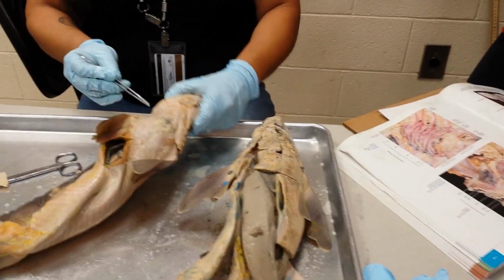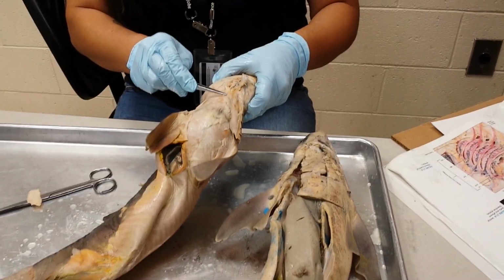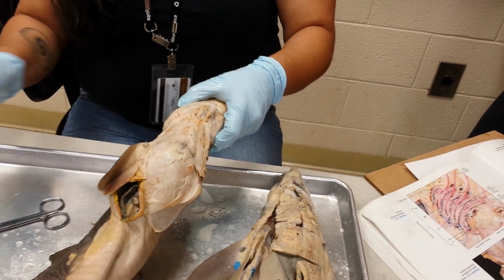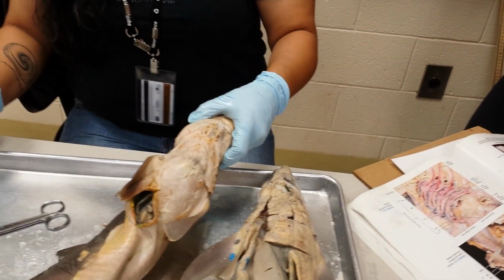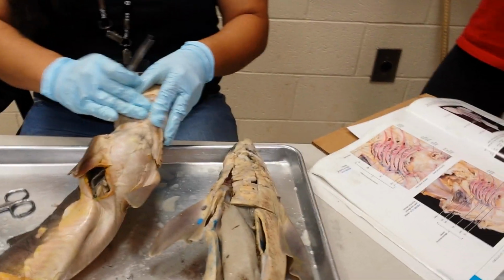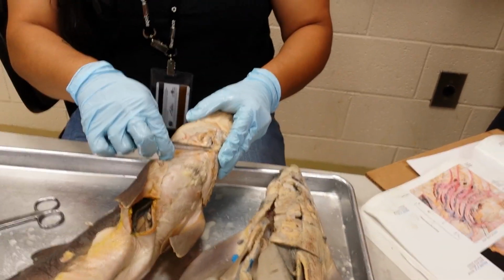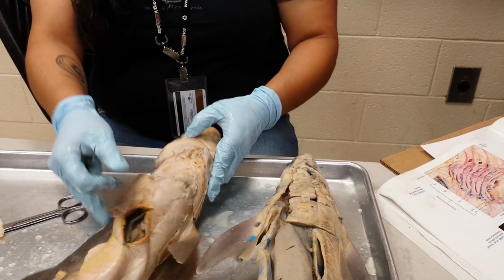So you have your coracoarcuals, the triangle. You have your coracomandibularis from the coraco area to the mandible. You have your coracohyoids, lateral and deep to the coracomandibularis, and the coracobranchials, which are lateral and deeper to the coracohyoids. Covering them, you have a layer on the outside, the intermandibularis. Underneath is the interhyoideus. Good? That's what you need to know up there.